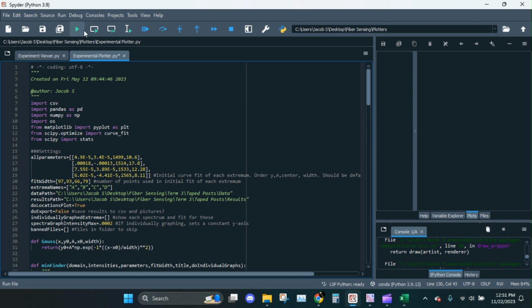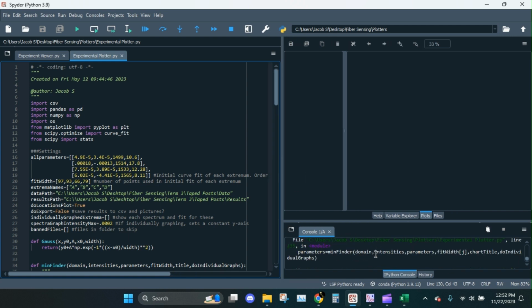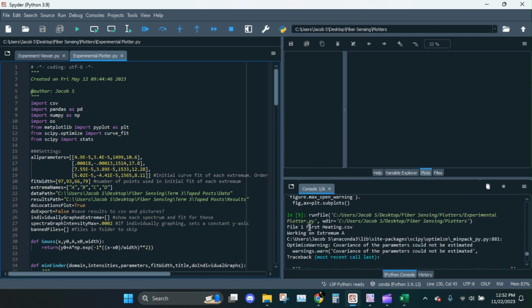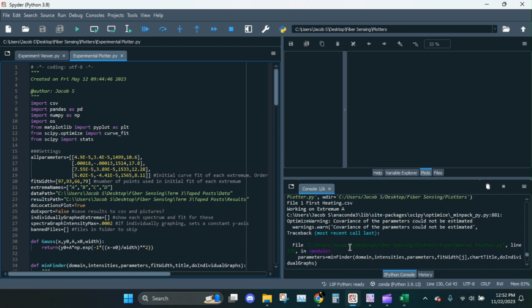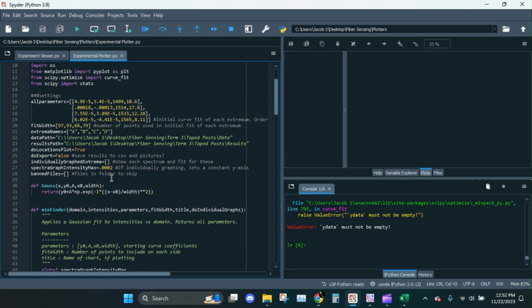Let's punch it, see what happens. We got an error already. That's lovely. Okay, so working on Extrema A. It didn't like it. Okay, so know how I was saying we can investigate things with this individually graphed Extrema? Let's do that. So we got its error in Extrema A. So I'm going to tell it to graph A.